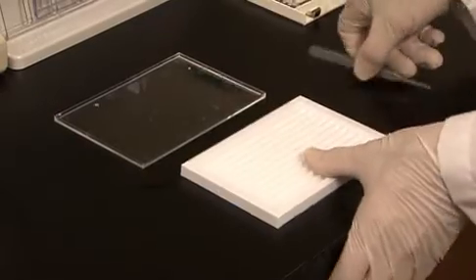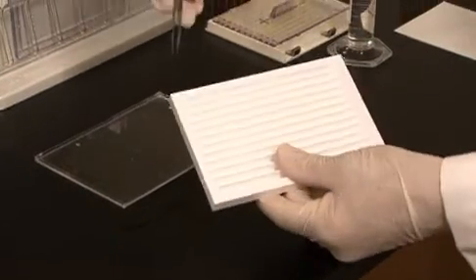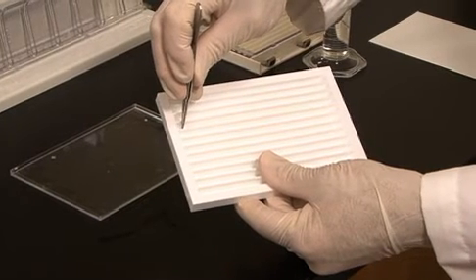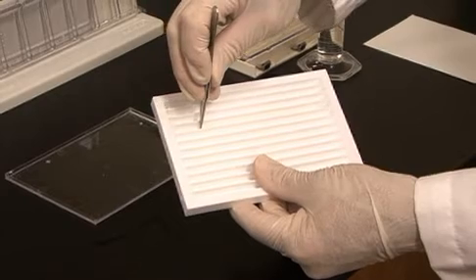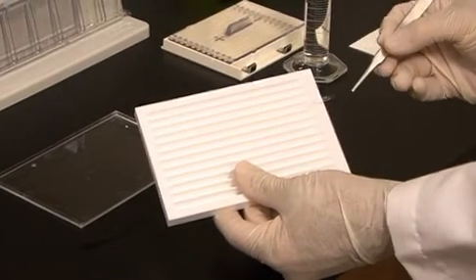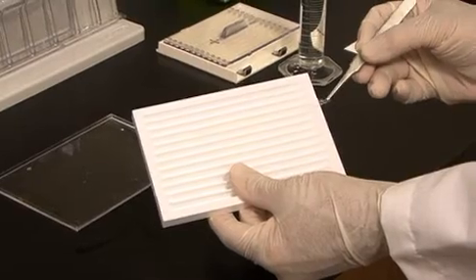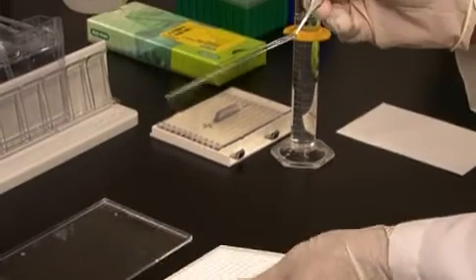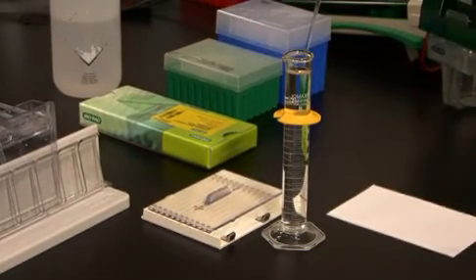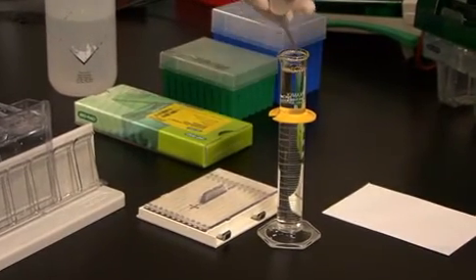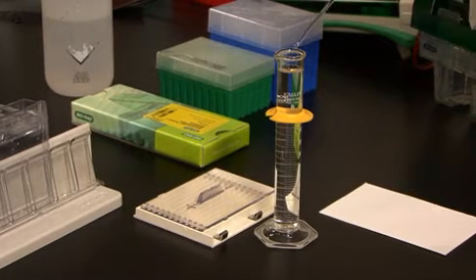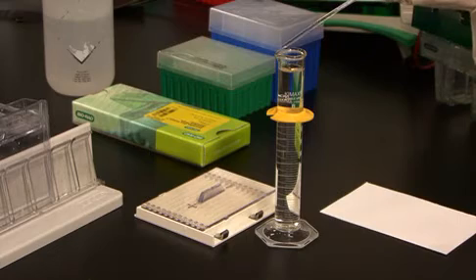To remove the strip from the tray, place the forceps on the tray and gently push on the plastic backing of the gel to push the strip towards the angled edge. Lift up the strip from the right tab. I am going to rinse the strip off in running buffer that I have previously prepared. Dip two or three times. This will remove the equilibration buffer that may still be on the surface of the IPG strip.